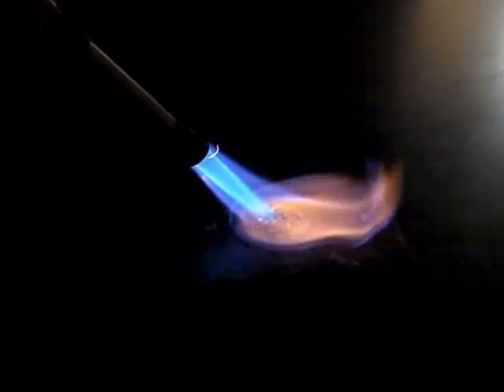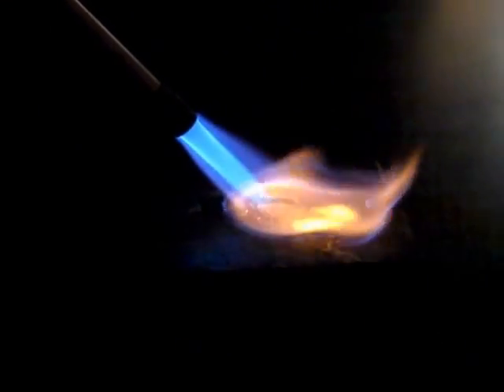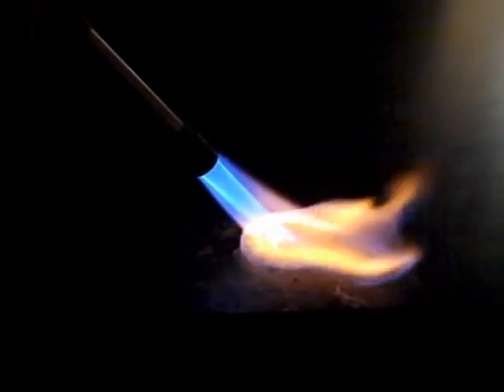I'm going to change my setting here a little bit on the burner. How well does the sample burn at this point? Not too well. Let's try one more time and see if I can get it to burn a little bit better. Jeff, are you ready? Go ahead and record. It smells like sugar. It smells so good.